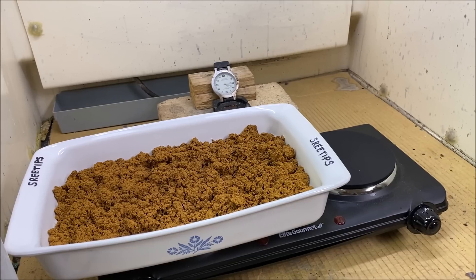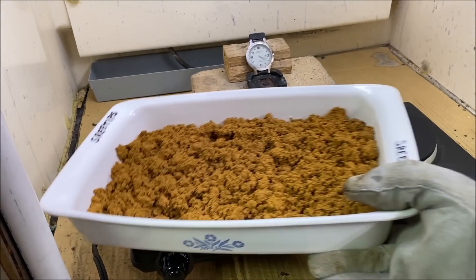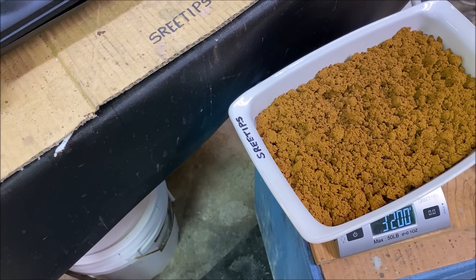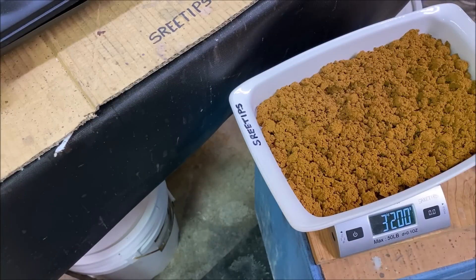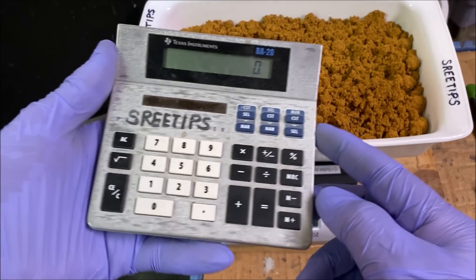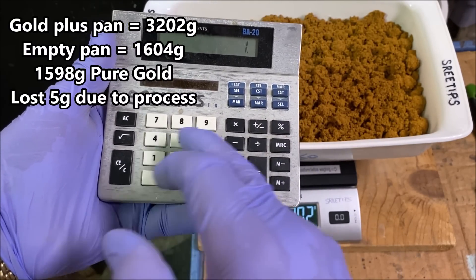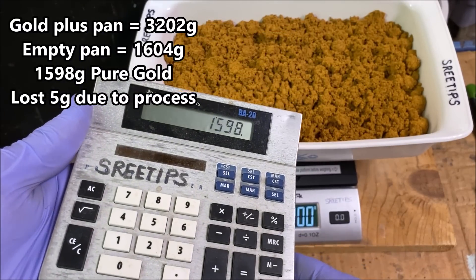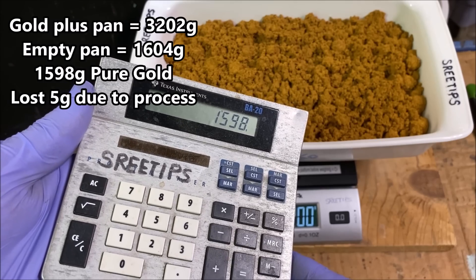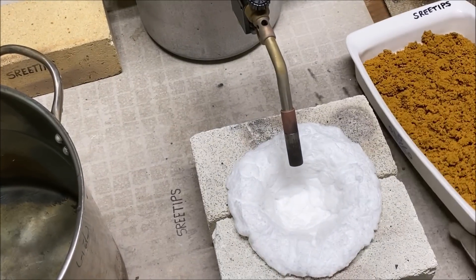I've got the gold dried off completely. Let's weigh the pan with the gold in it now — we've got 32.02 grams with the pan and the gold. The pan was 16.04 grams, so we got 15.98 grams of gold. We started with 16.03 grams. On to the melt table — we're going to start melting this gold now.